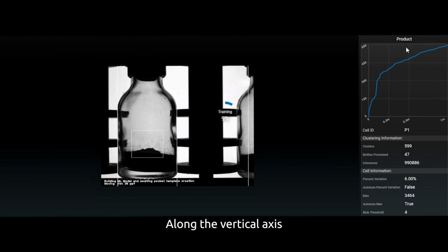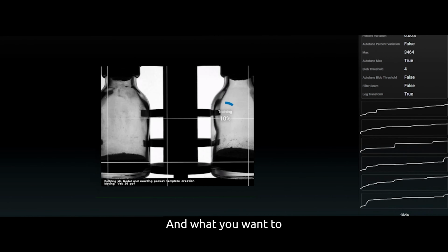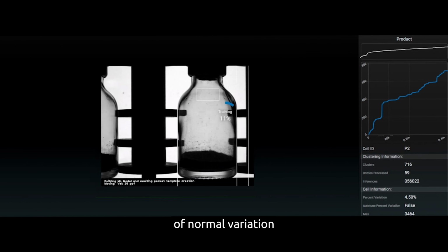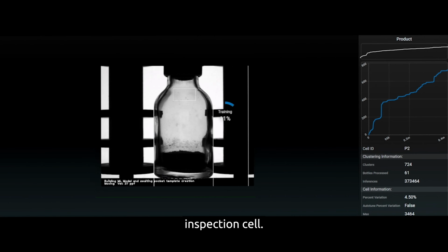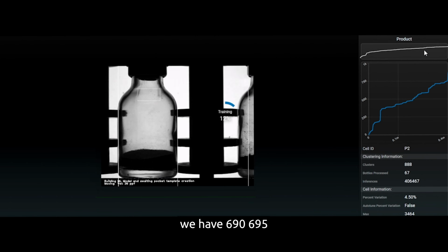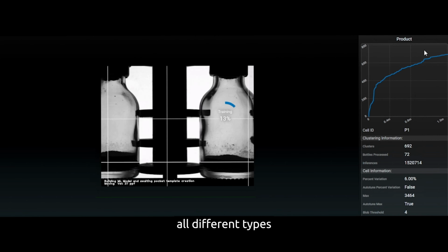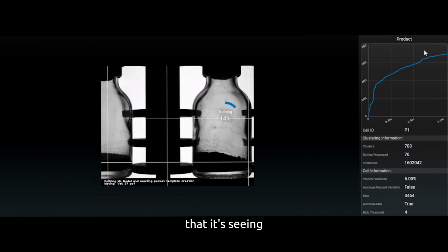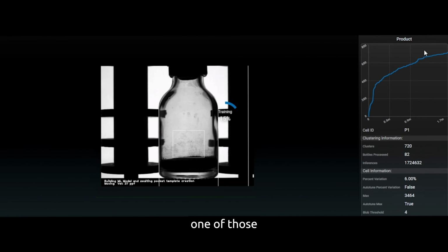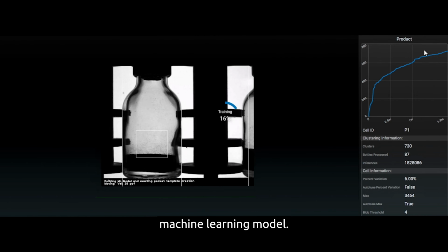Along the vertical axis you see the number of clusters that are part of that model, and you want to think of a cluster as one unique snapshot of normal variation for that particular inspection cell. What you see here already is 690, 695, 700 clusters being added to this model, all different types of normal variation that it's seeing in compliant vials for that particular region of interest. Each one of those regions of interest has its own unique learning curve and unsupervised machine learning model.